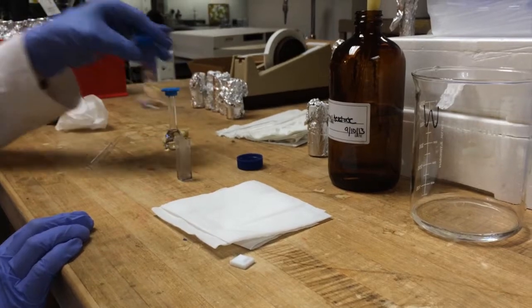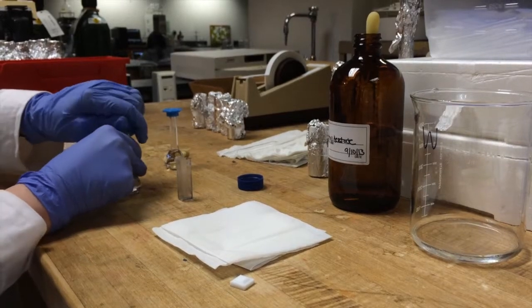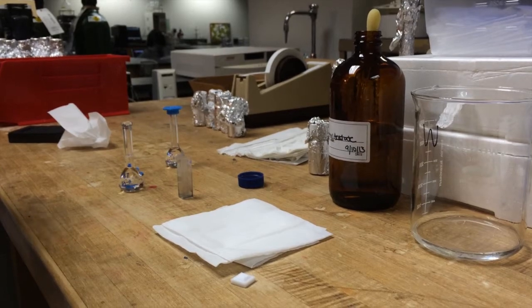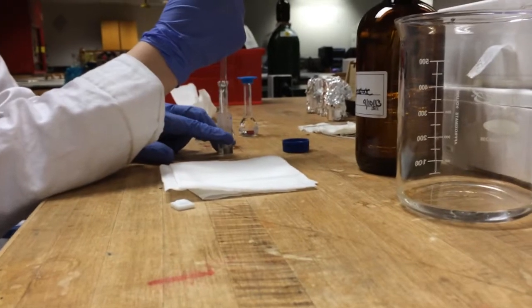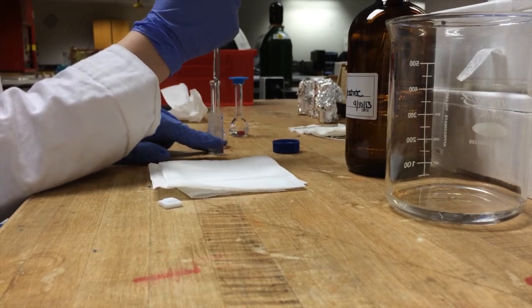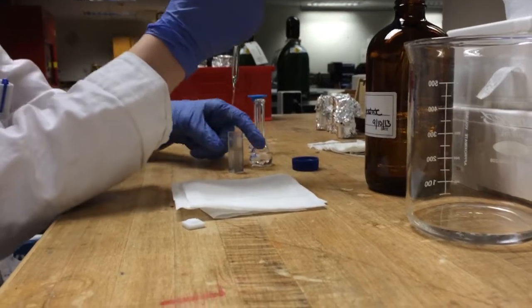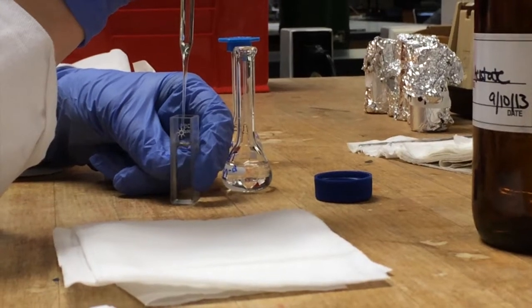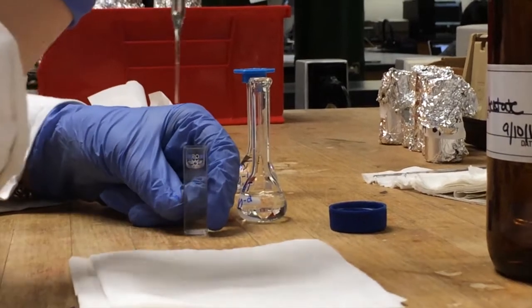And then you're going to take your more dilute sample, which is our second dilution, which we nicely labeled VBT 10 to the negative 2, and use your clean pipette to fill up to about the sun on the cuvette. It doesn't need to go all the way up to the line, because then we won't have enough sample using these small volumetrics. Normally I like to think that about there is good.